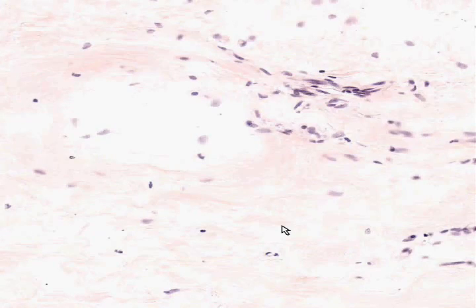Another thing we could say about connective tissue in general is that dense connective tissue is more likely to be regular or like tendinous, and loose connective tissue is more likely to be having fibers going every which way. A general rule of thumb is that every spindly looking cell within connective tissue of any type is a fibroblast until proven otherwise. Loose connective tissue is more likely to have other types of cells, however.